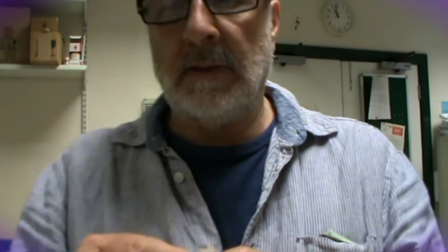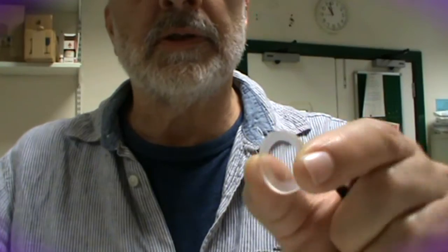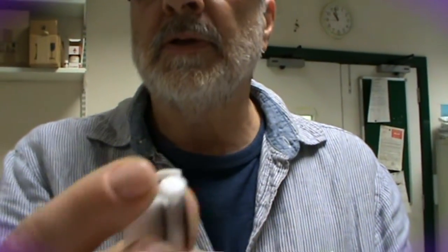The types of cells I'm talking about are these demountable round cells that you can purchase with path lengths from 5 to 100 microns, or this type of cell, or rectangular cells like these. You'll need access to a UV spectrophotometer, normally used for measuring absorption spectra. I'm using a Cary 3 instrument, but the software should be roughly the same for all instruments.